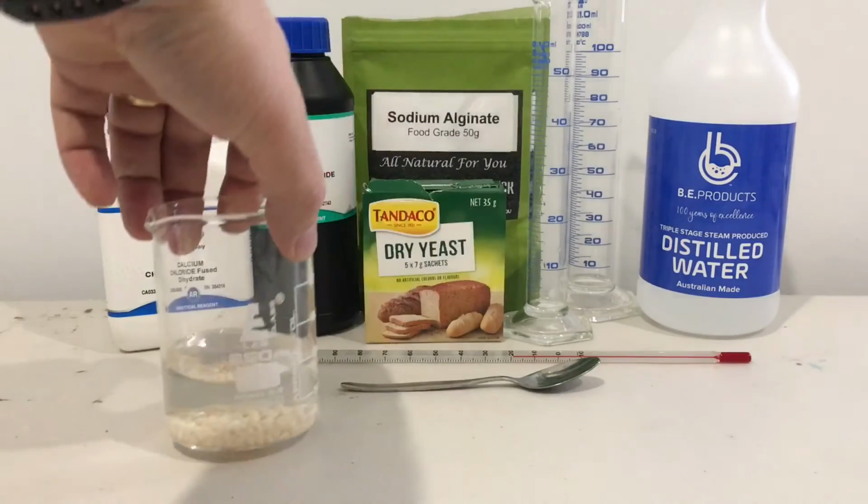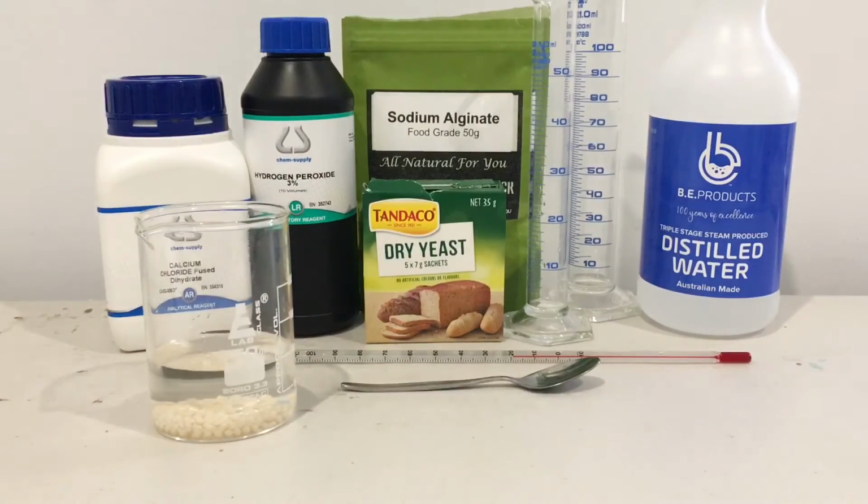Okay, so what we'll be doing with those today is dropping them into a diluted form of hydrogen peroxide. We're going to use a range of 0.1 to 0.3. I've had to test the range before we did the experiment to get appropriate measurements in time. So we'll be dropping sodium alginate yeast balls into a hydrogen peroxide concentration and waiting for them to rise.